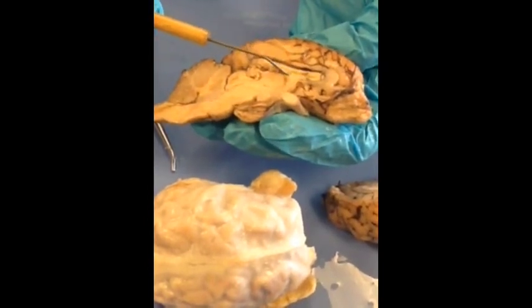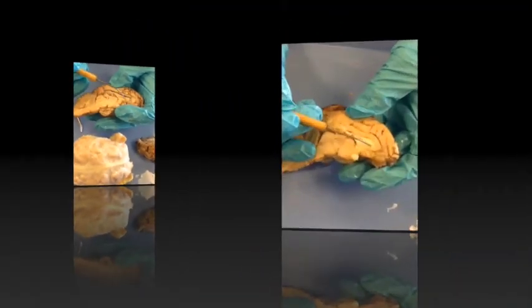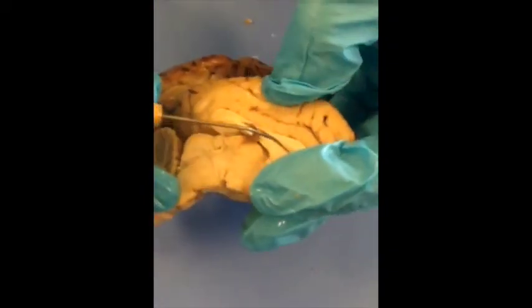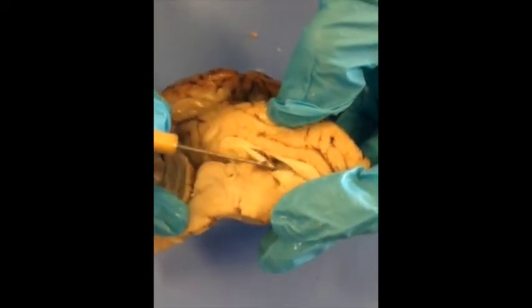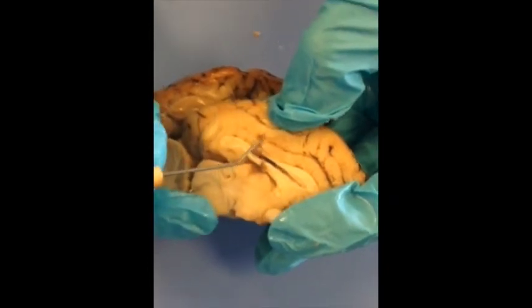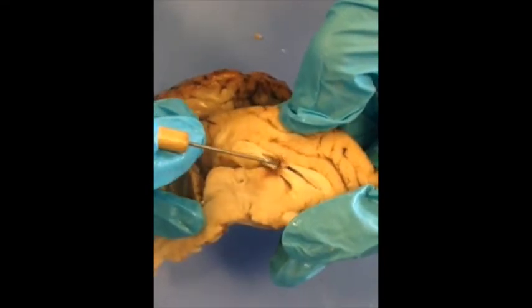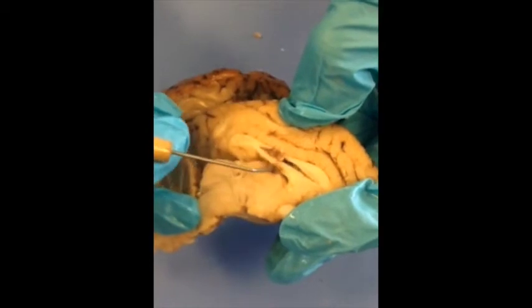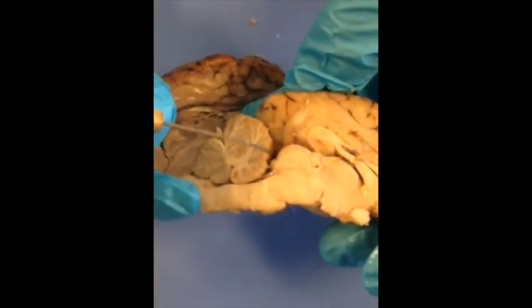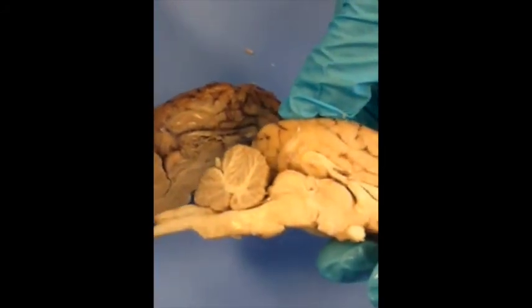This down here is the fornix. All this brown that you're seeing is vascularity. Here's your corpus callosum, and the fornix below. This encloses your lateral ventricle — this is all your lateral ventricle. In the lateral ventricle is your choroid plexus, which is the cells and vascularity that produce your cerebrospinal fluid. There's also a little choroid plexus near the third ventricle. Here's the aqueduct, then the fourth ventricle, and then it passes out through the central canal of the spinal cord.